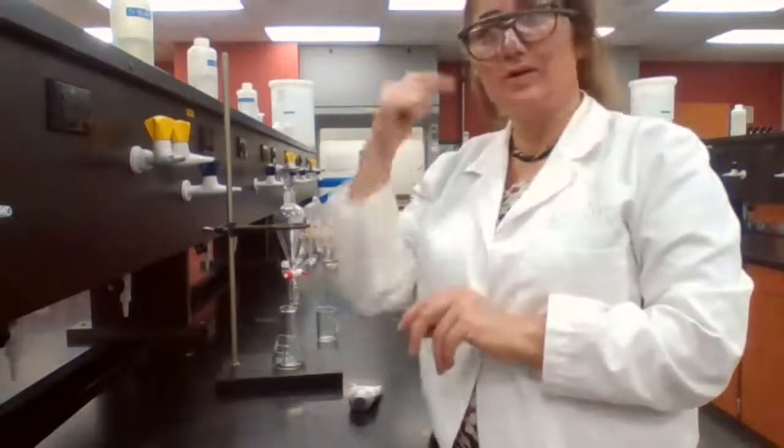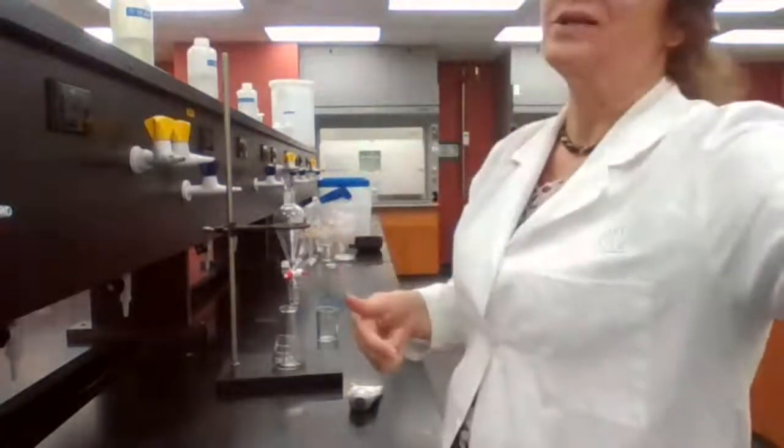Shaking, venting, separating. Please write somewhere so you remember those 3 words, just like the other day that I told you, like 5 minutes icing of the crystallization mixture, 5 minutes vacuum filtration to remove as much as possible of the moisture and the solvent, and then 5 minutes placing in the oven for dryness, and you check it to make sure it's dry. But that's 555, it stays for recrystallization. Shaking, venting, separating stays with extraction.